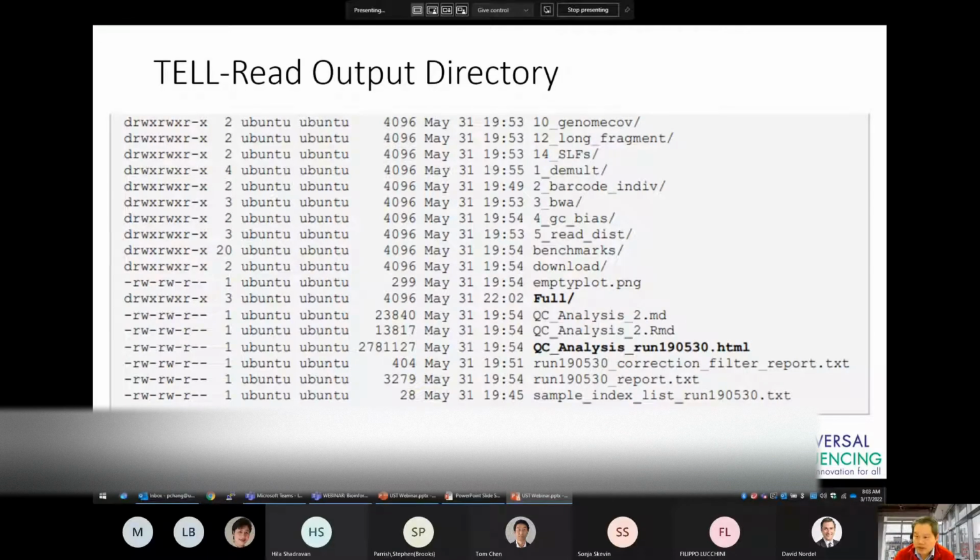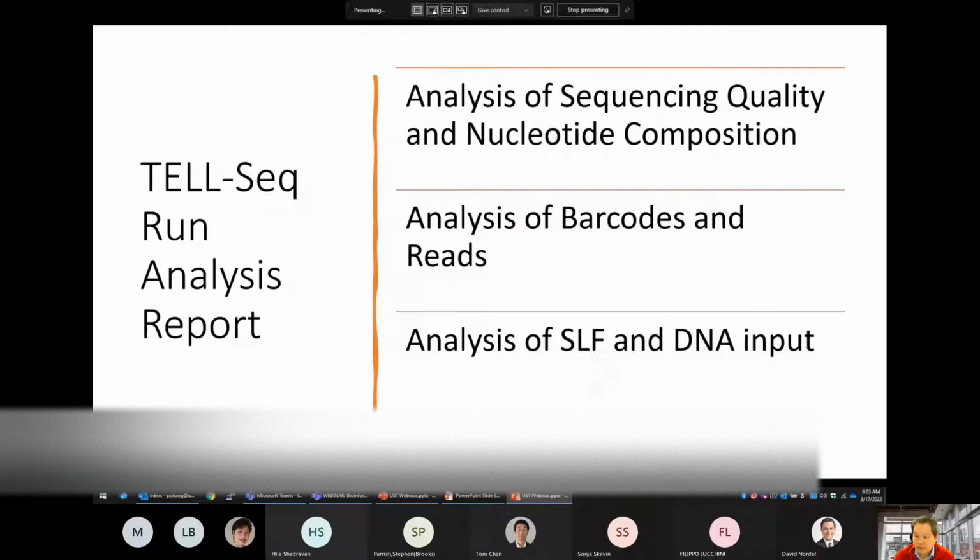When the TELL-Read analysis completes, your output will be contained in several files and directories. The full directory shown here will contain FASTQ files that you can use for phasing, de novo assembly, and any other downstream process. The output also contains a QC analysis report on the TELL-Seq data, and I will go over this directory and this file in the next few slides.